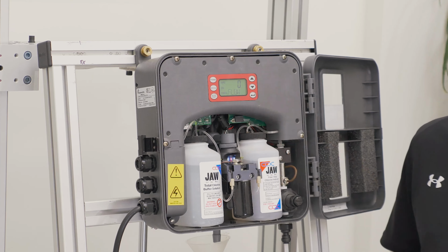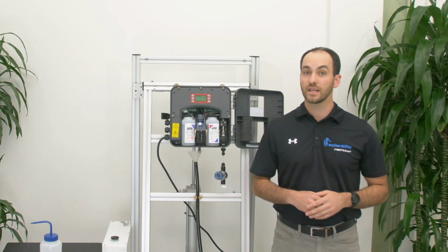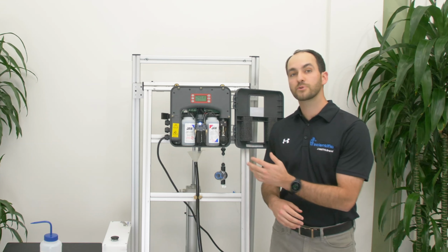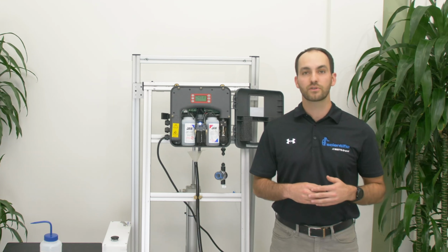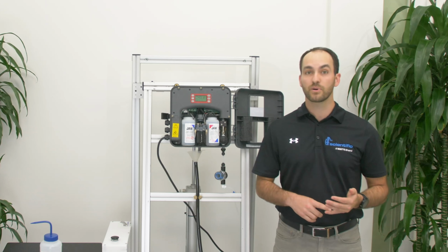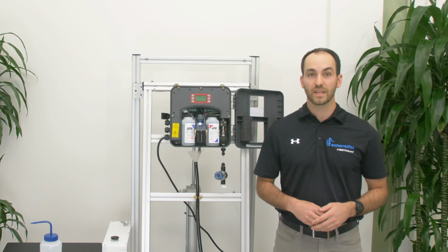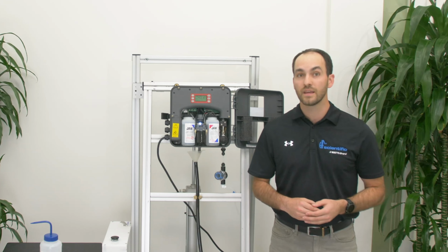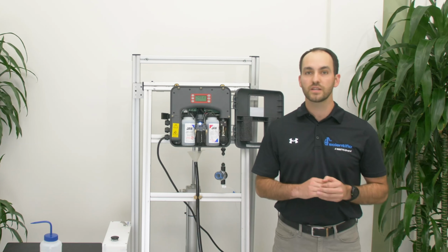Once you have set the flow test to 10 to 12 clicks, let the analyzer run to ensure the error has cleared. With an air gap drain and a consistent 10 to 12 clicks on the flow test, the NPRG error should be cleared. If it has not cleared and you can still see water inside the cuvette, it may be time to clean the lines on the drain solenoid.